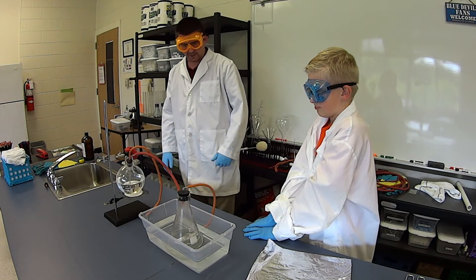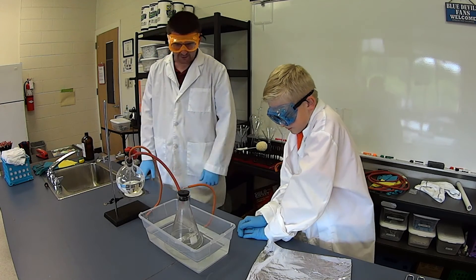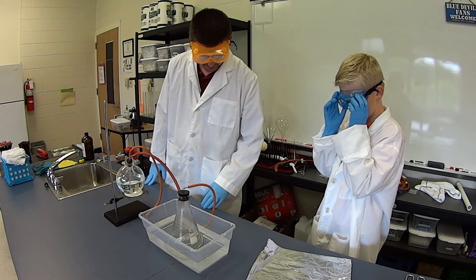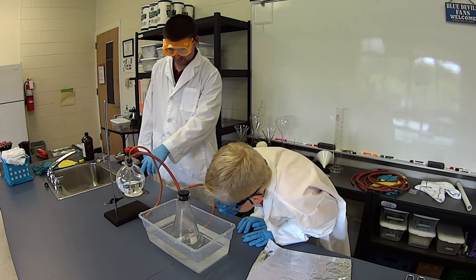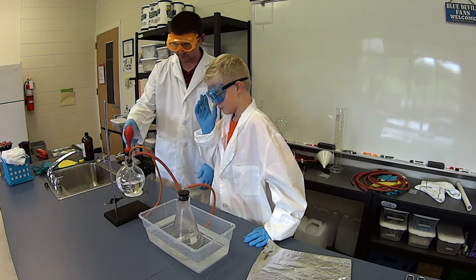We're going to let that sit for a couple minutes, and shortly we'll begin to see it bubbling and reacting. You start to see some little bubbles forming in the acid there — that's hydrogen gas escaping out. They're going through the hose, and now you can see they're bubbling out into here. You can see the bubbles coming out into our water there — that's going to rise up into the balloon.